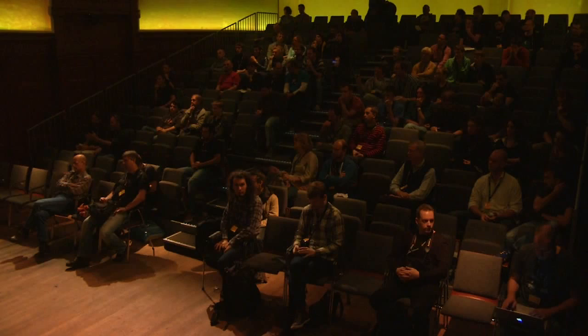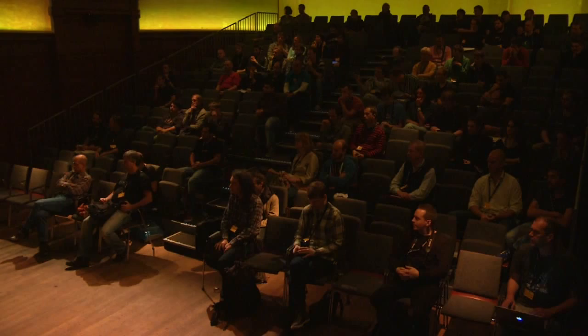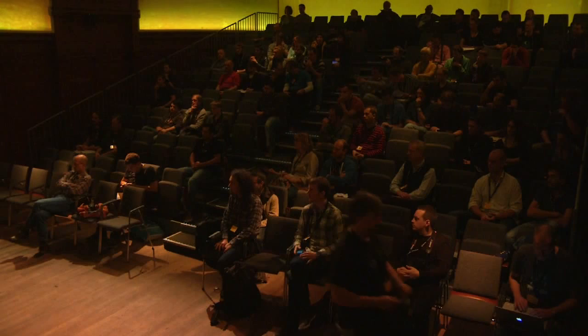Hello everyone, I'm Biagio, the developer of the software together with Jan Jorstad, also from EPFL. I want to give you a practical demonstration.